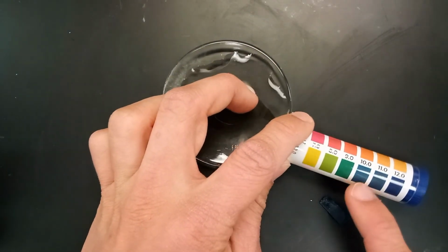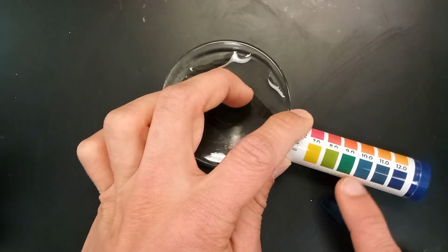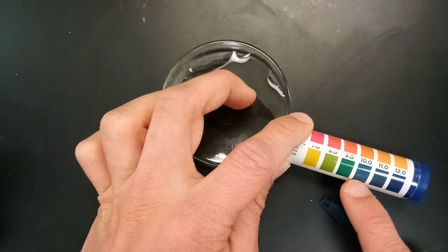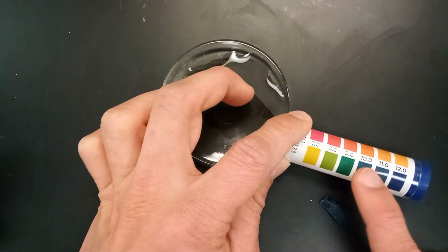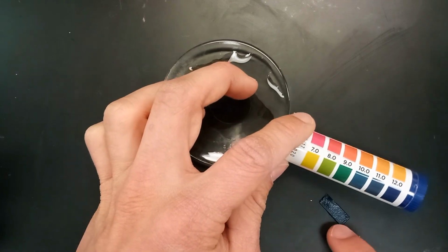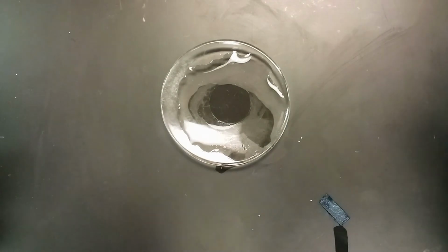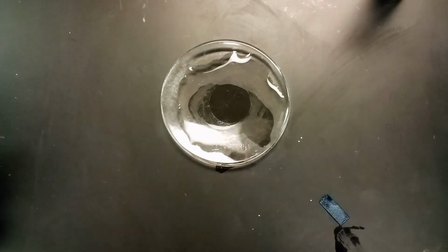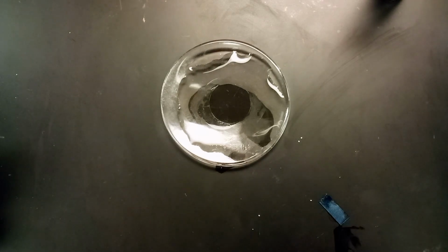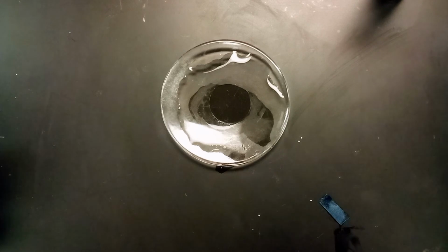It's pretty dark, to be honest. It's much darker than a 9. Maybe it's somewhere between a 10 and 11, honestly. 10 seems to be the best fit, probably. But yeah, that's pretty dark. So that's kind of a nice giveaway. I mean, it's so distinctly different than other ones that we've seen before. And that's number 12. So that's all of the data that we really need to collect.